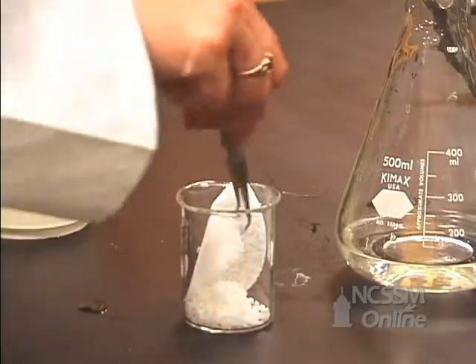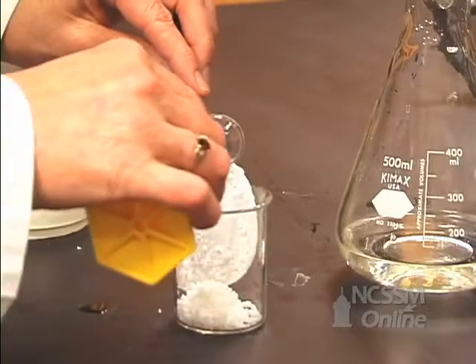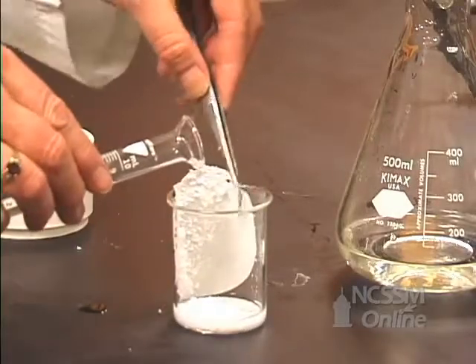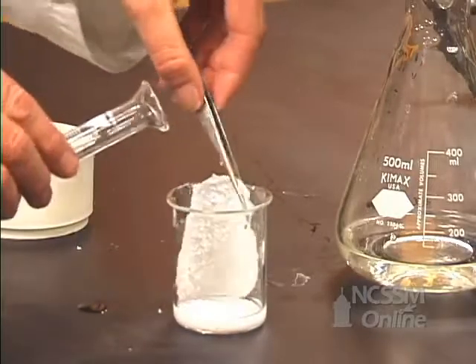This is ethanol, and we will rinse the crystals off of the paper with our alcohol.